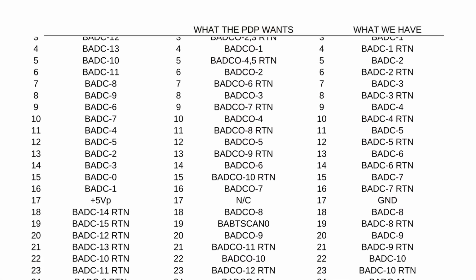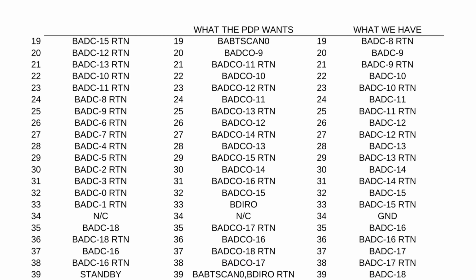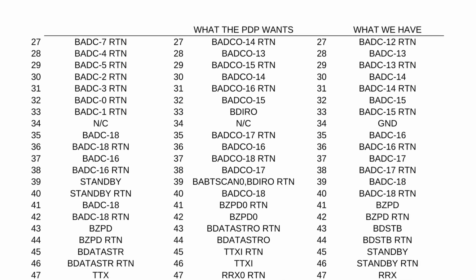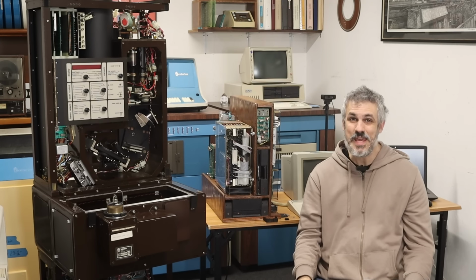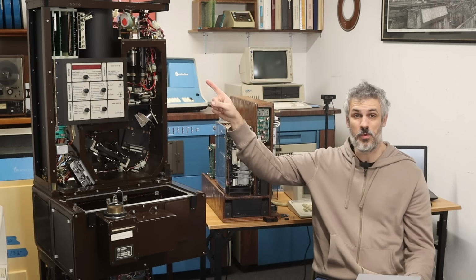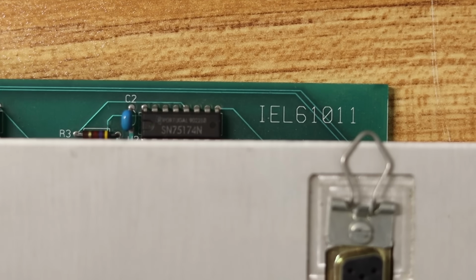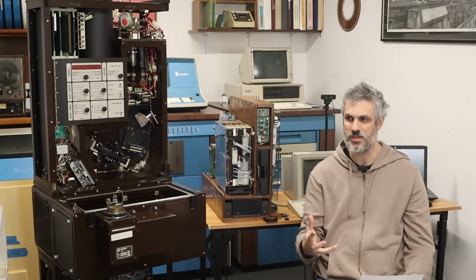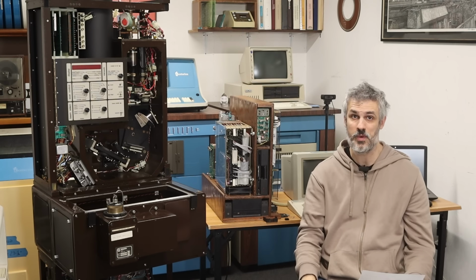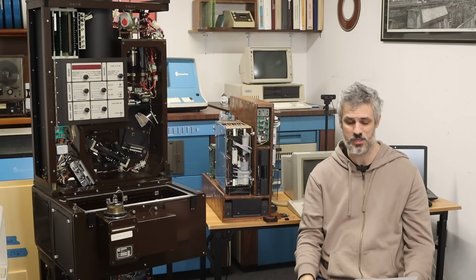There are 3 different revisions of opto-isolator boards for the Bomem, but they all have incredibly different wiring. We have a revision problem going on here. We need the IEL-27 opto-isolator board in the Bomem, and we've got the IEL-61. So how do we fix this? Well, the appropriate thing to do would be to wait and see if Mike has an IEL-27 in his stash, but Mike is not sure that he does because nobody's used a PDP-11 on a Bomem for like 30 years.